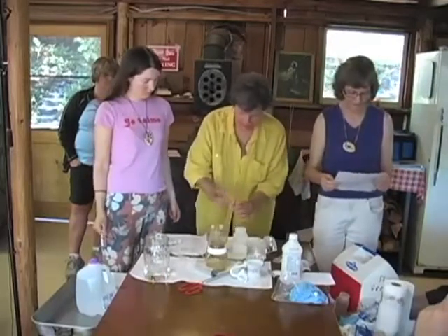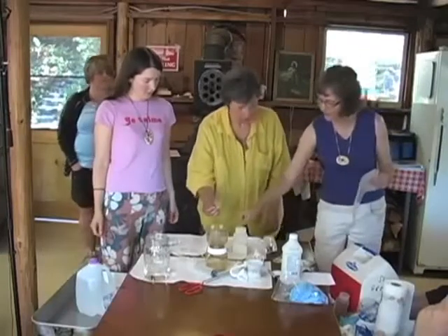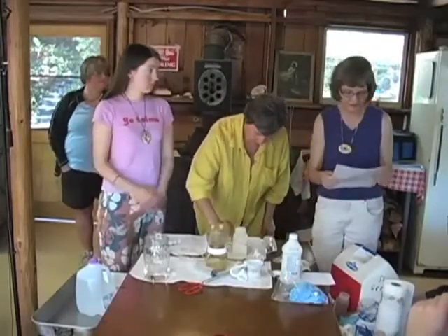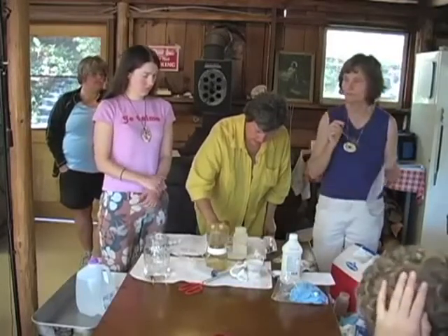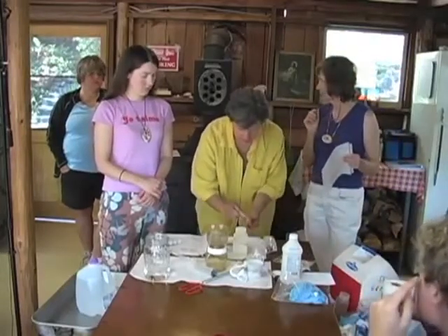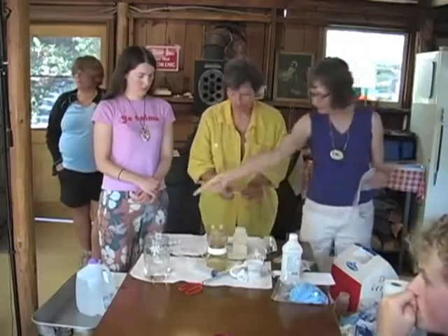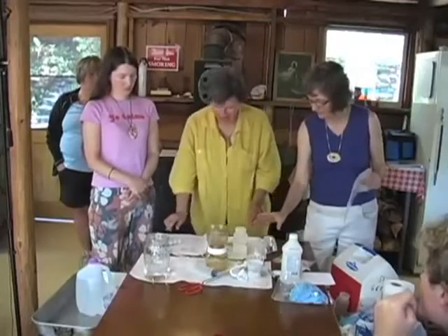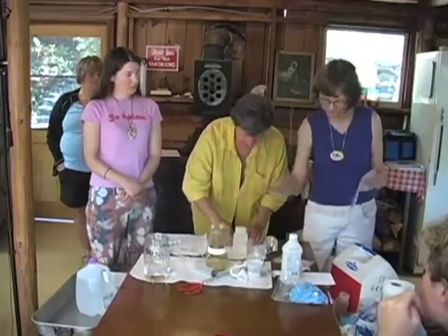Now the nutrient. Would you like to add the nutrient? Yeah, just spread all of it around. You're going to empty it. It's measured out already. What kind of nutrient is this? It's just called fecal coliform broth. Fertilizer, basically. This carefully goes back on. Good. Set it aside.